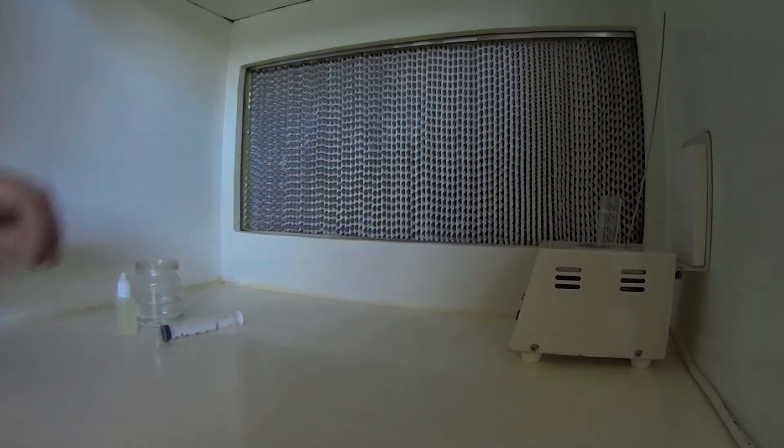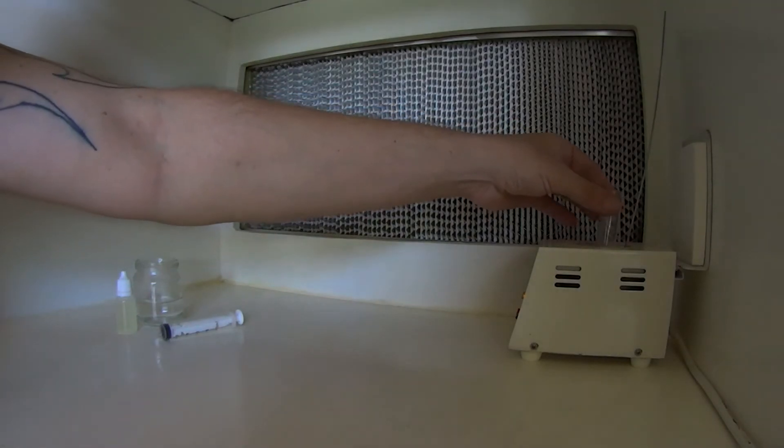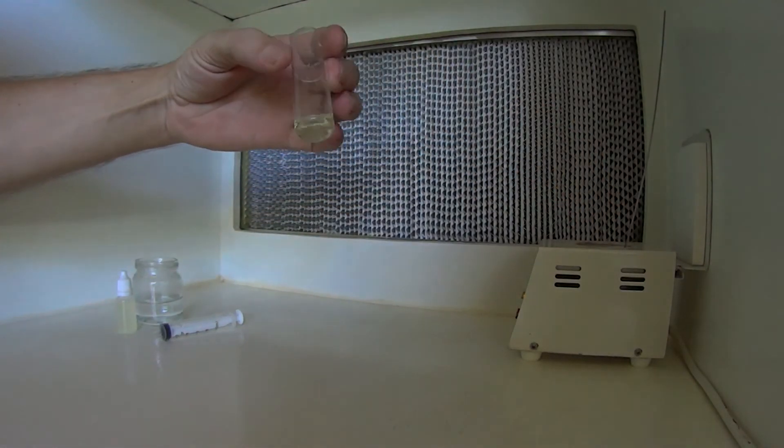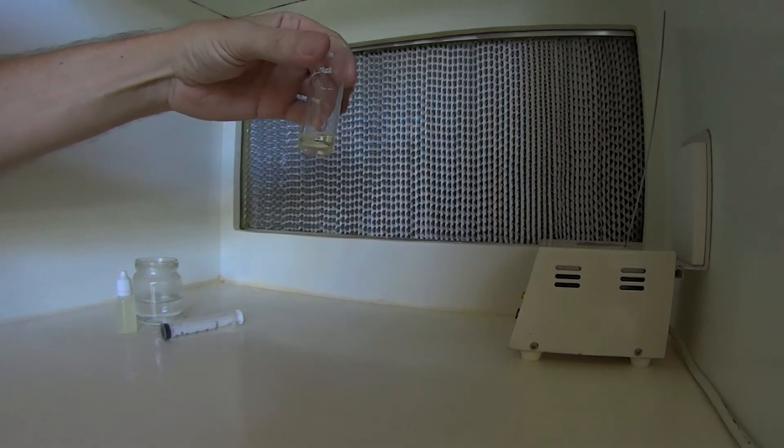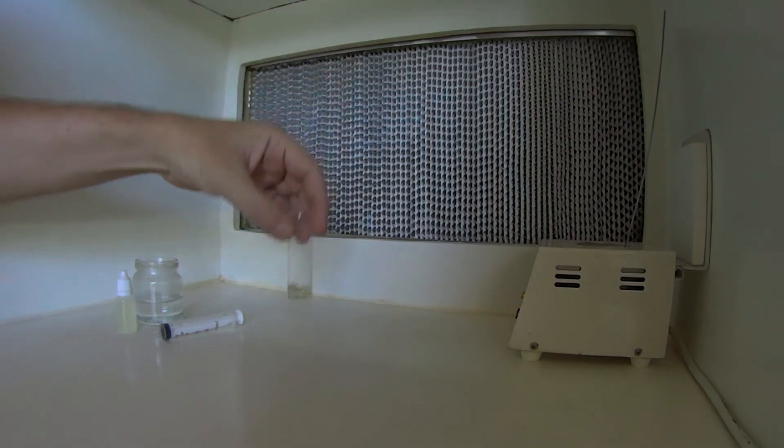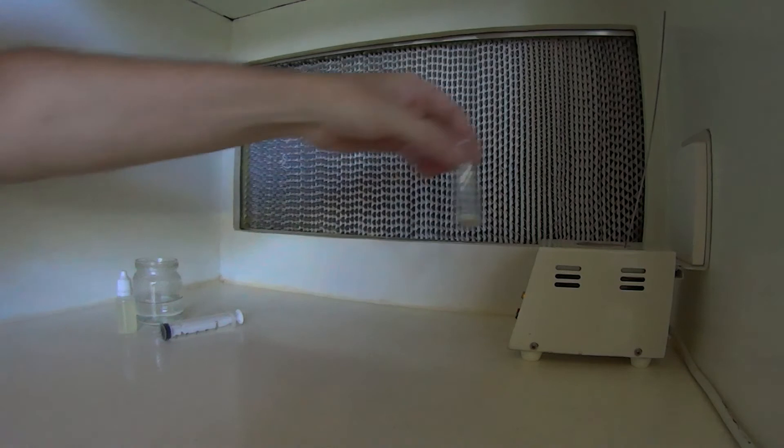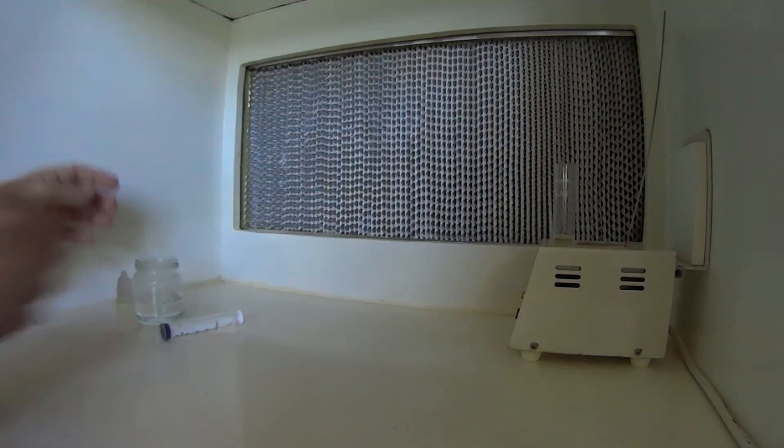Alright, couple of minutes now, and we'll just have a look. Pull it out of the glass bead. Bit hard to tell, but she's all dissolved in there nicely now. Now what we need to do now is, I'll just sit that up out of there, add some water to it.